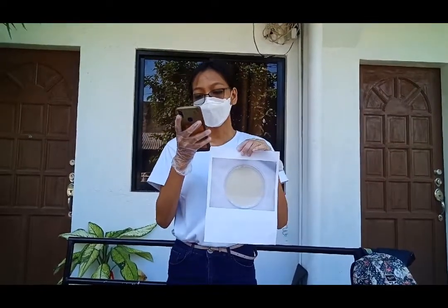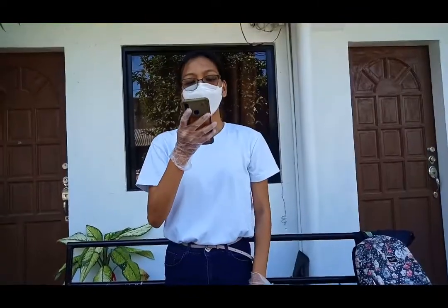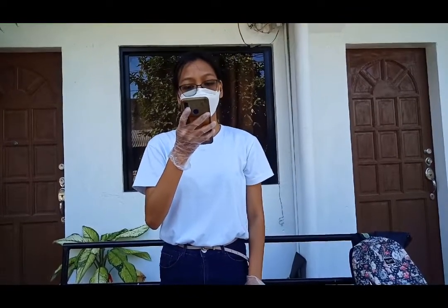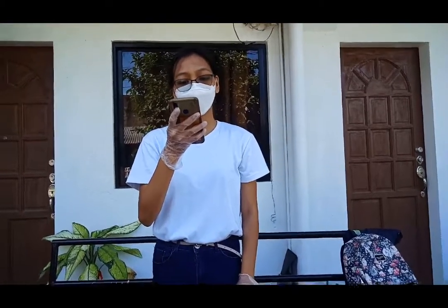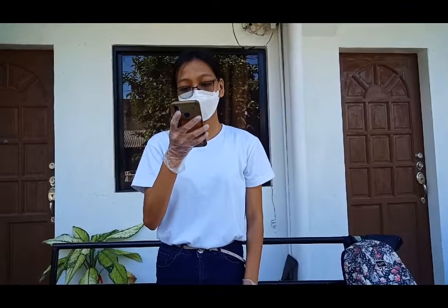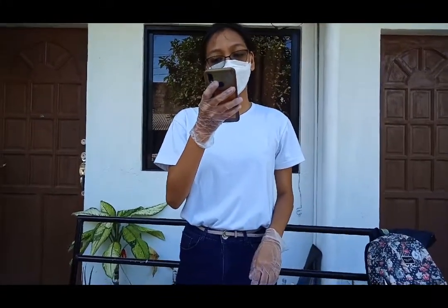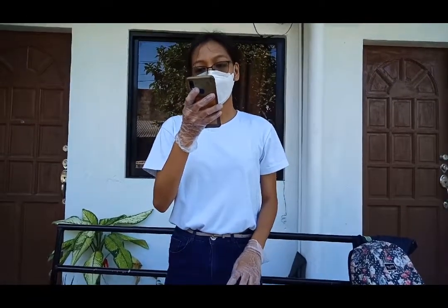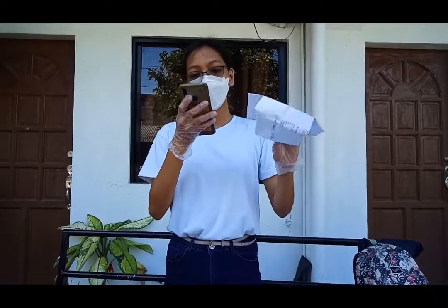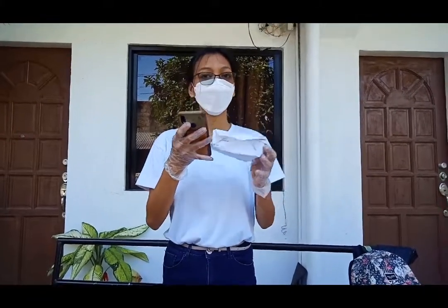And wear gloves, mask, and face shield when performing this activity. Then choose two inanimate objects to swab for bacteria that will be cultured. It could be on the table, in the windows, on the computer keyboard, on your cell phones, or in the sink. Place the specimen in an incubator if available. But if you don't have access to an incubator, place the plates in a box and store it in a corner where it won't be touched or contaminated. And keep it there for at least 24 hours.